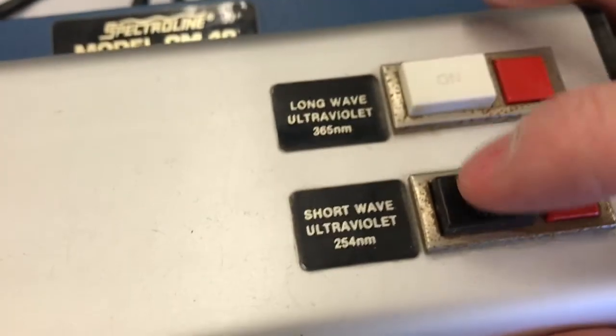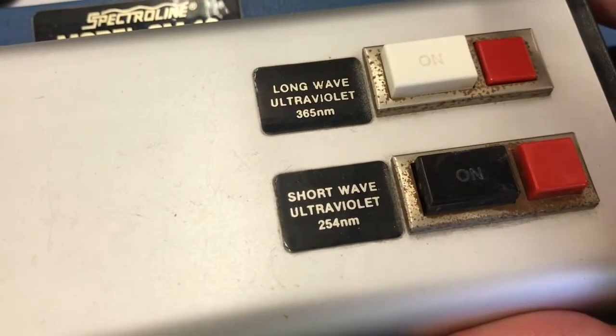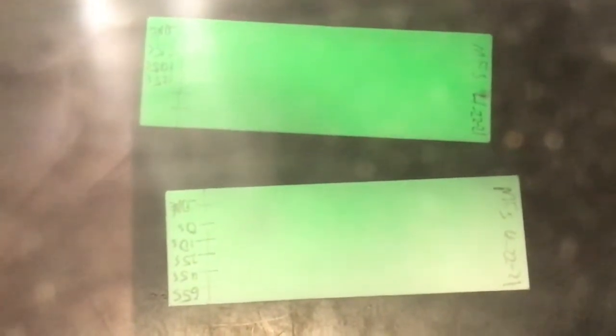And my TLC plates, I already prepared them. And I just thought of something. It's a good idea when you prepare your TLC plates before you spot them to check them to make sure nothing's splattered on them. So let's look really quick. I'm gonna go short wavelength, 254 nanometers. When I look in there, they look pretty good. I do see maybe a little spot on one of them at the top by my initials, but they're fine. They look clean enough. So that's good.